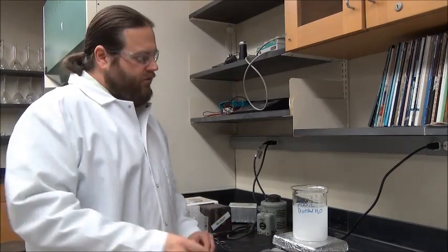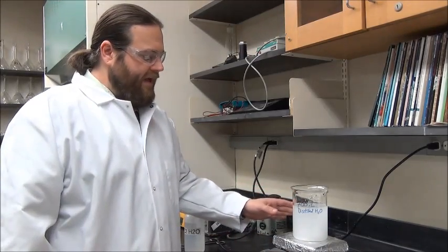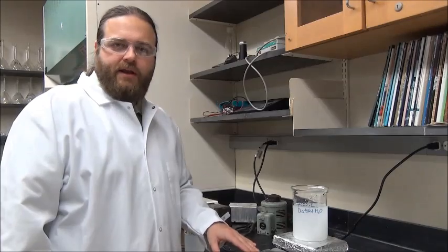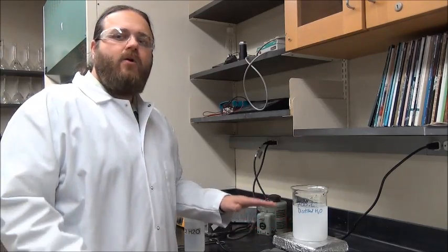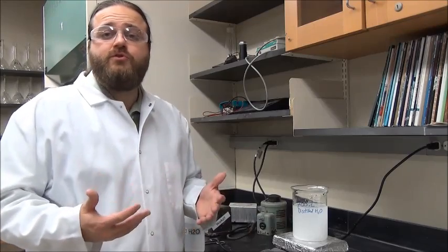Here we go, we have our alum added, the hot plate is warming up, we have our stir bar going, the solution is stirring, and now we're simply going to wait for the solution to heat up.